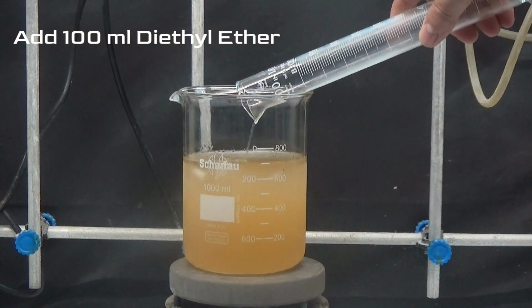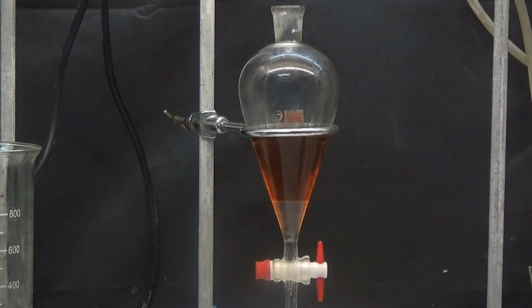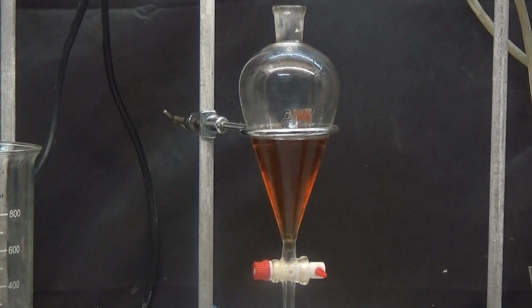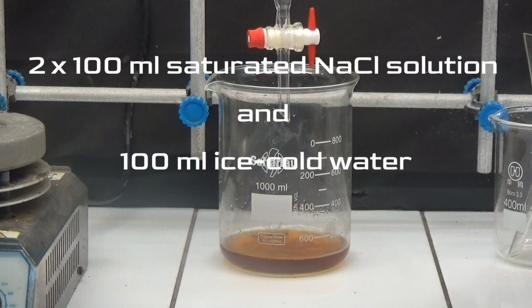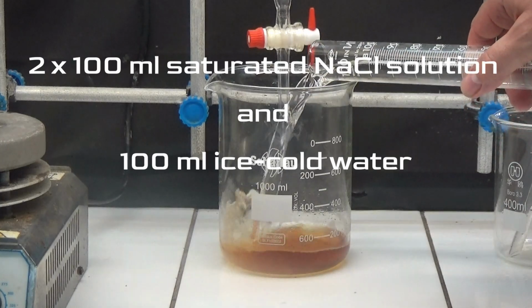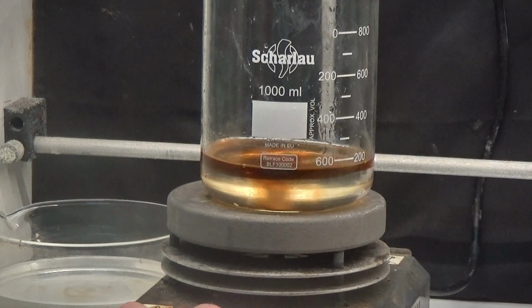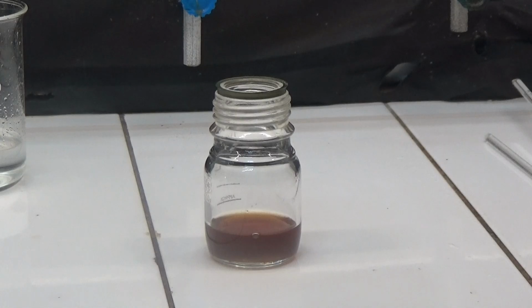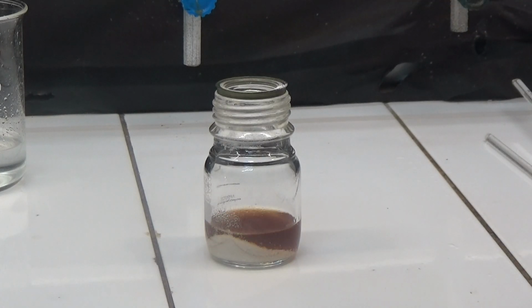Add 100 milliliters of diethyl ether and stir for 20 minutes. Separate the layers in a separating funnel. Wash the ether layer twice with 100 milliliters of saturated sodium chloride solution and 100 milliliters of ice-cold water. Separate the ether layer, dry with anhydrous magnesium sulfate, and evaporate the ether in a hot water bath after filtering.